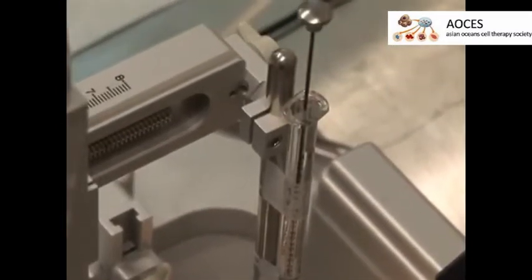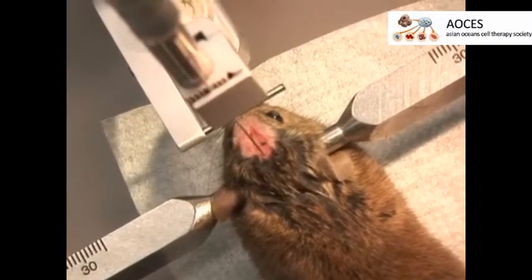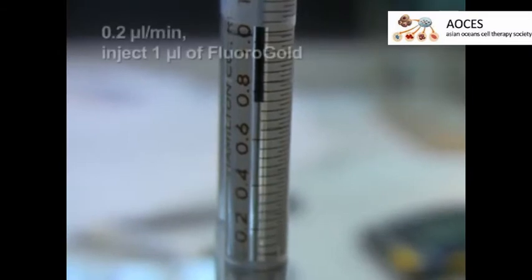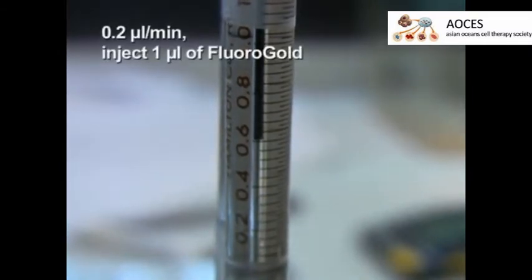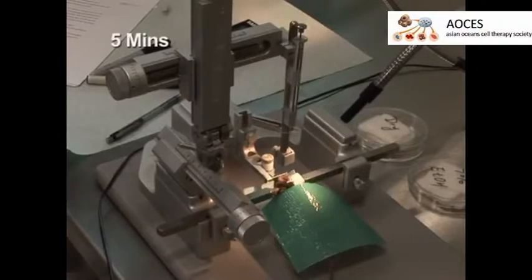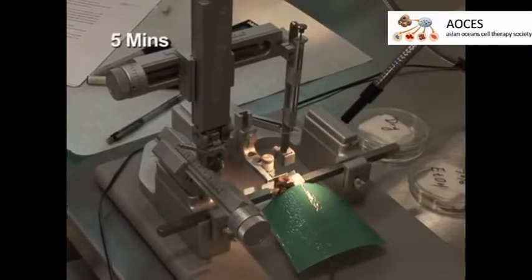Once a suitable hole has been drilled, position a Hamilton syringe over the hole. Ensure that the needle has clear passage through the meninges and lower the tip of the syringe to a depth of 1.6 mm from the surface of the brain. Then, very slowly, at a flow rate of 0.2 µL per minute, inject 1 µL of fluorogold neural tracer dye into the superior colliculus. Allow the needle to sit in place for 5 minutes to prevent the fluorogold from diffusing up along the needle track.